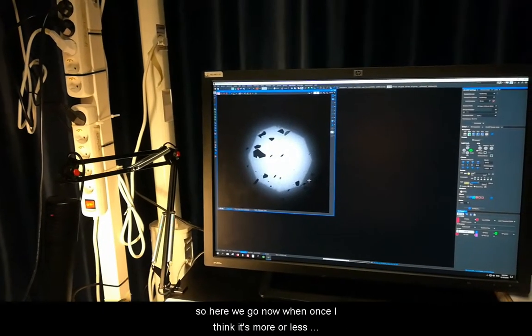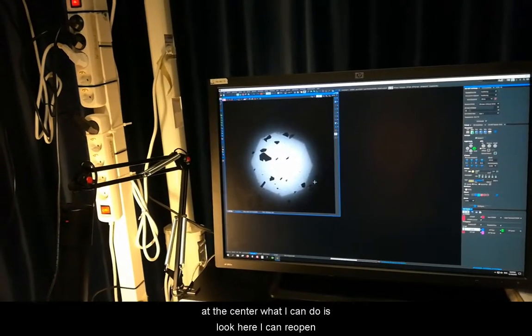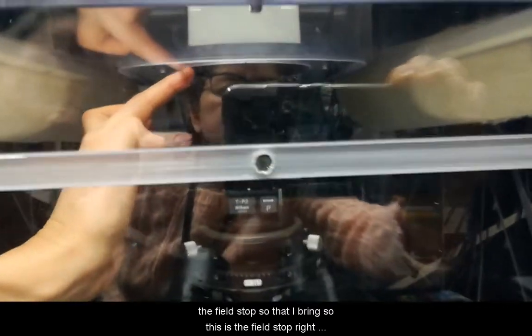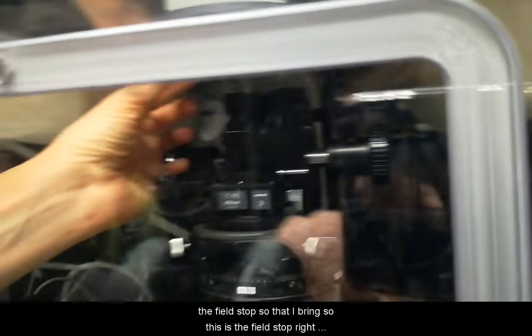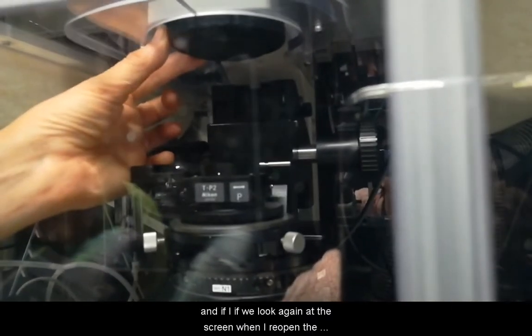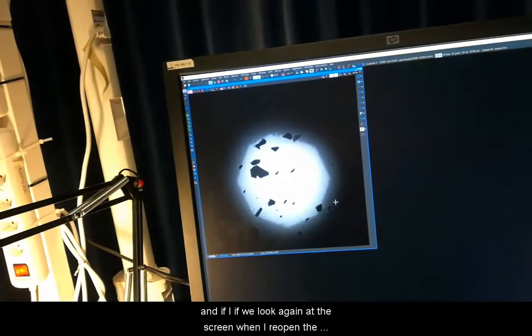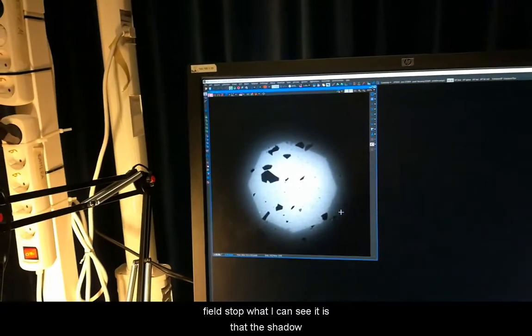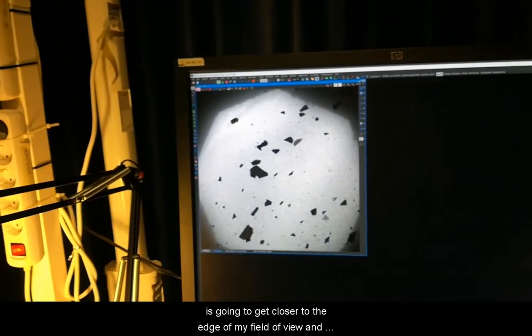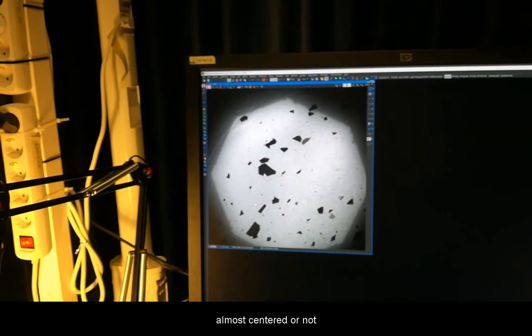Once I think it's more or less at the center, what I can do is reopen the field stop. When I reopen the field stop and look at the screen, the shadow gets closer to the edge of my field of view. That's very convenient so I can see whether it's almost centered or not.